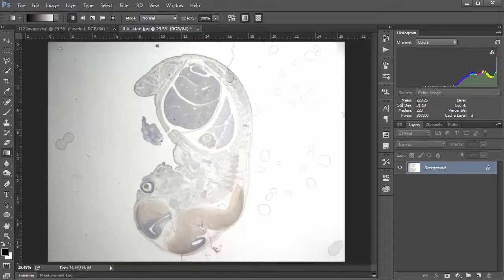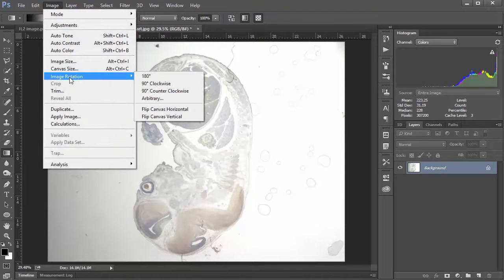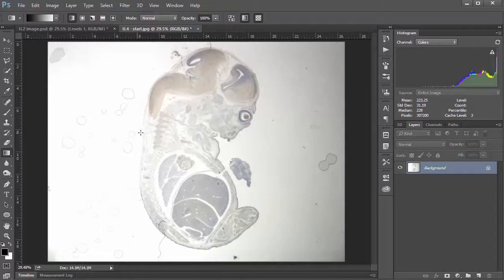So the first thing we want to do, obviously, is rotate this image 180 degrees, which we can do quite simply by going up to Image, choosing Image Rotation, and choosing 180 degrees. The next thing we want to do, which is going to get us most of the way there, is a pretty tight mask around our little section here to get rid of all of these air bubbles and hairs and all this other crap.